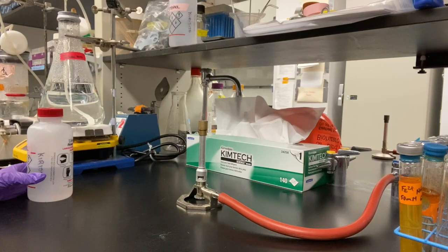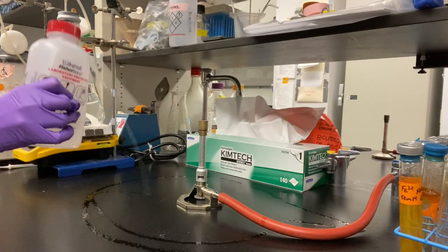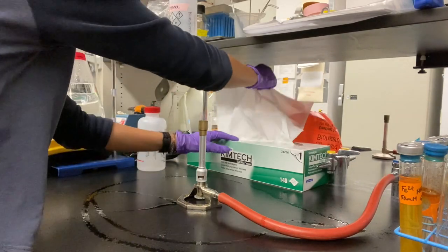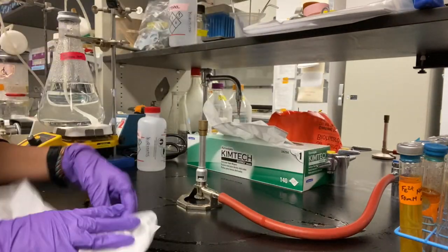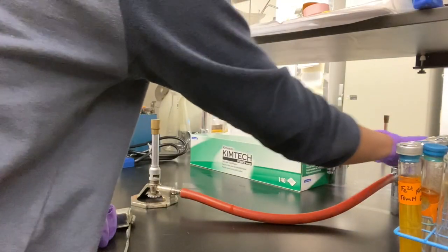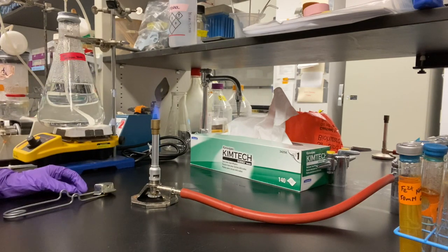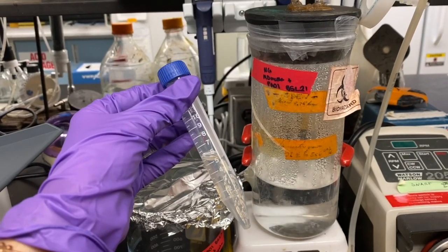Spot plates are used to enumerate the concentration of bacteria in liquid media through serial dilutions, typically in the ratio of 1 to 10. We always start by sterilizing the workbench with 70% ethanol, and then lighting the Bunsen burner. Collect a cell culture sample from your chemostat.